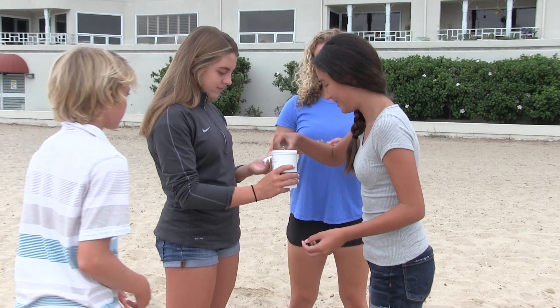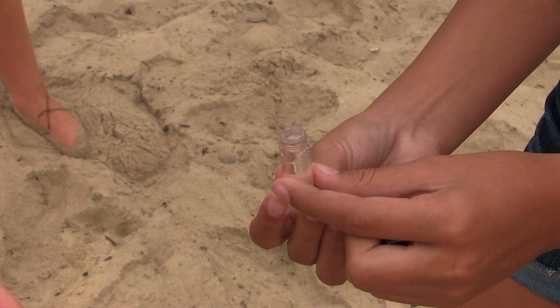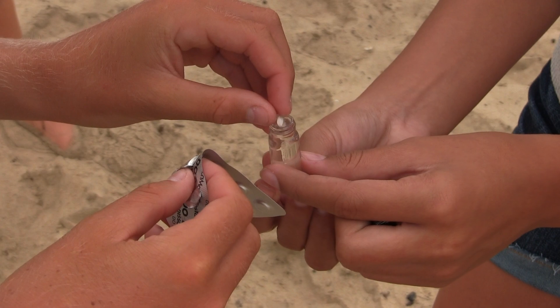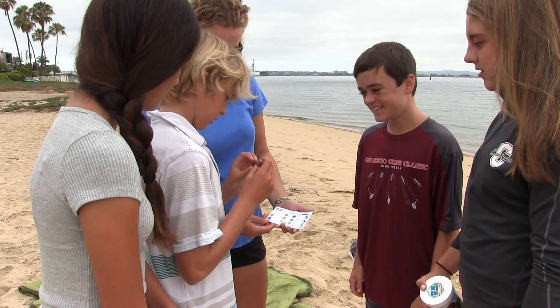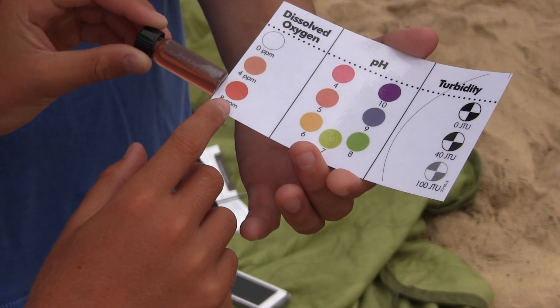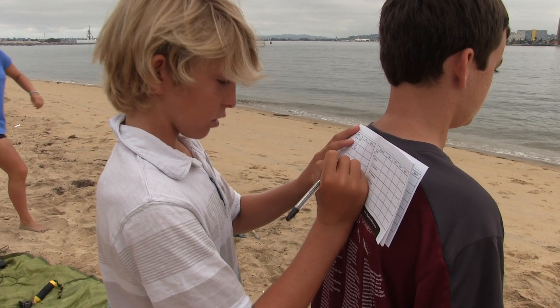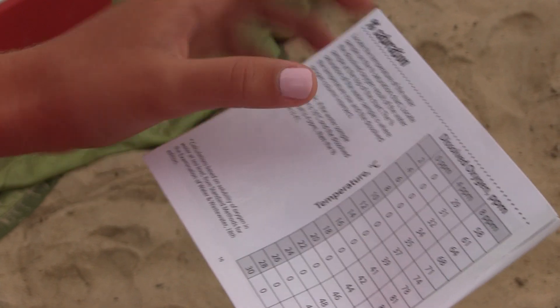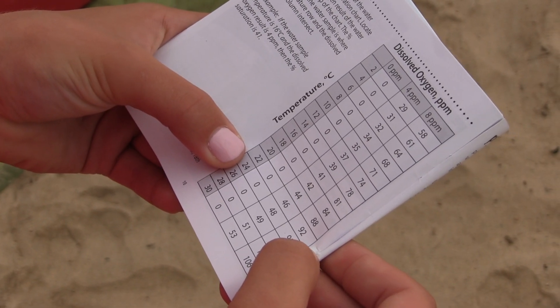Submerge the small vial into the water sample. Carefully remove the vial from the water sample, keeping the vial full to the top. Drop two dissolved oxygen test tabs into the vial — water will overflow when the tablets are added. Screw the cap on the vial and make sure no bubbles are present in the sample. It will take about four minutes for the tablets to dissolve, then wait five more minutes for the color to develop. Compare the color of the sample to the dissolved oxygen color chart and record the results as parts per million. Find the percent saturation by locating the water temperature and dissolved oxygen result on the percent saturation chart in your information booklet, and find their intersection.